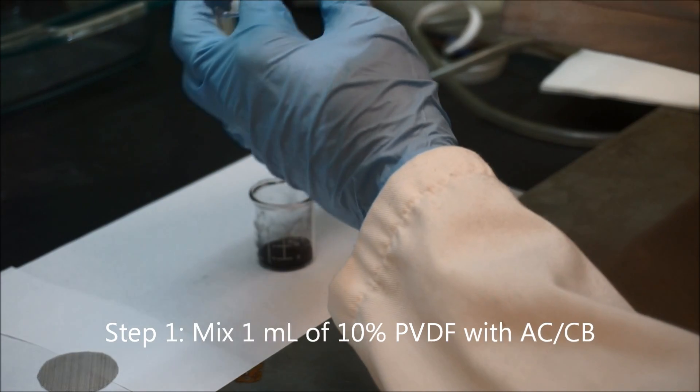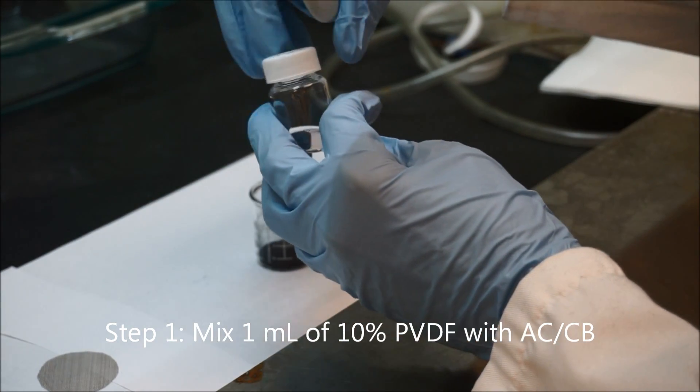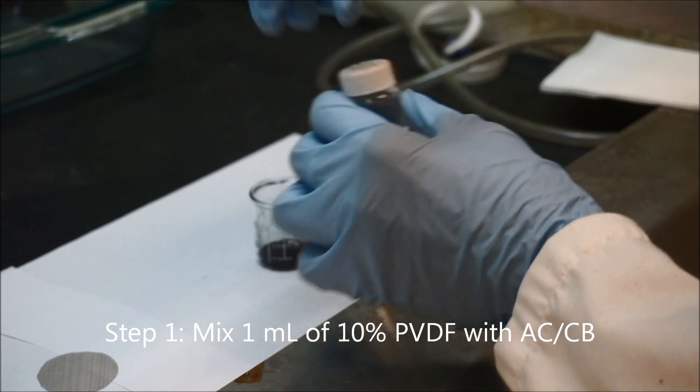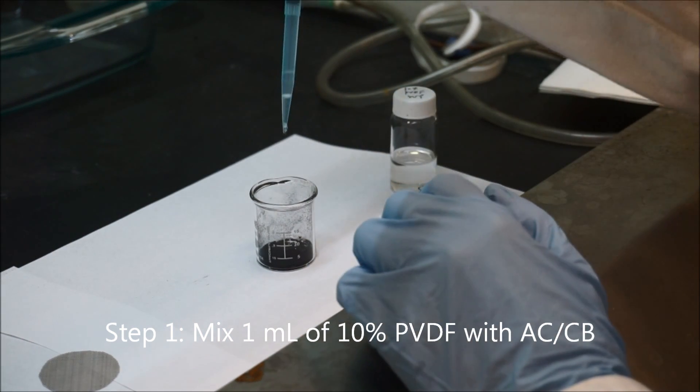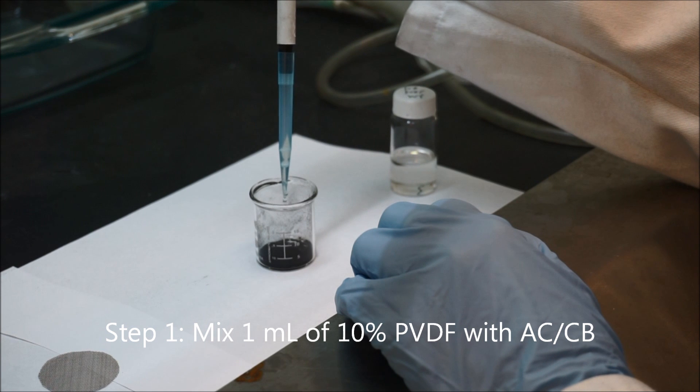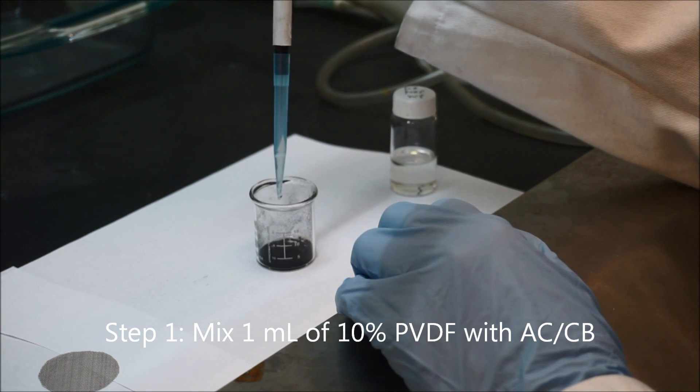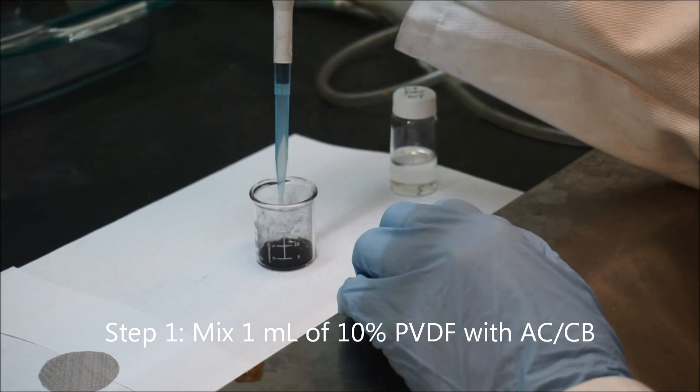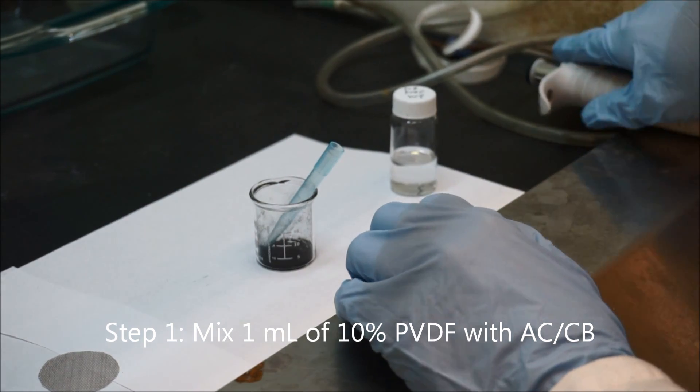The solvent is a bit toxic, so remember to cap the bottle after you take out the solution. Then use the pipette to mix the carbon powder with the PVDF solution.